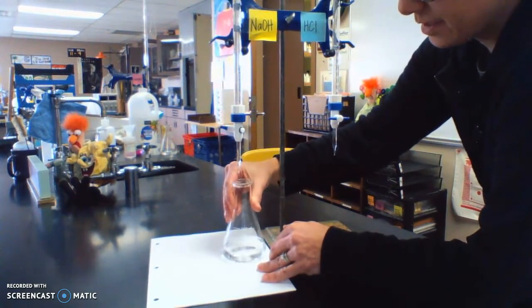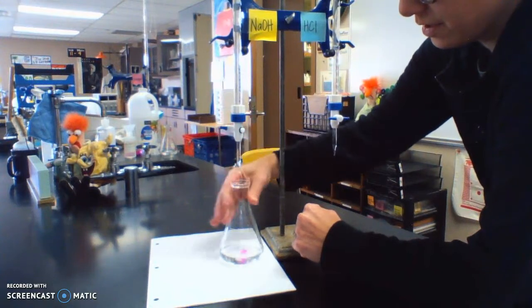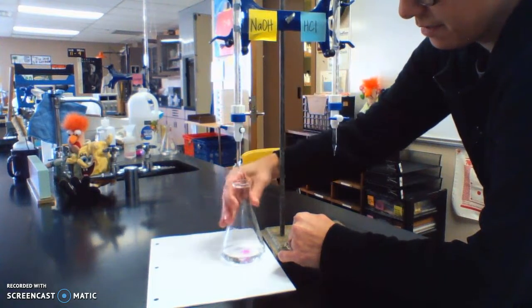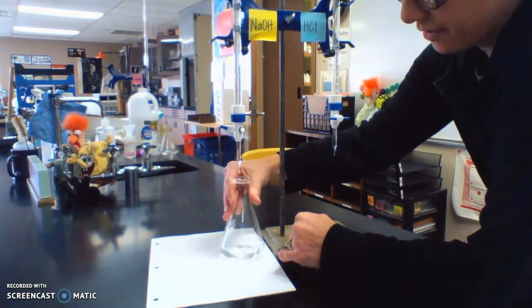Ooh, right there. We are right at the edge. And all right, I'm going to call that right there.